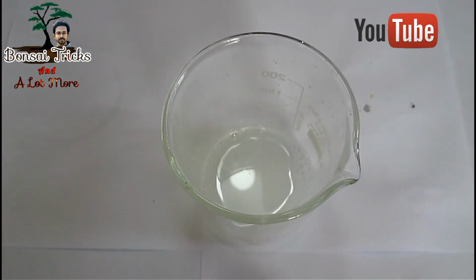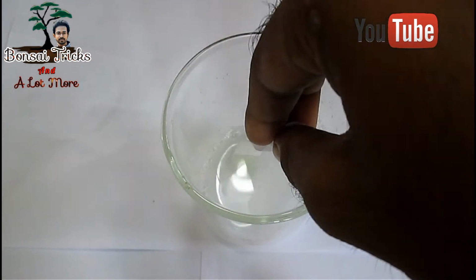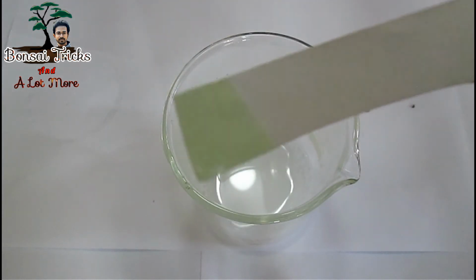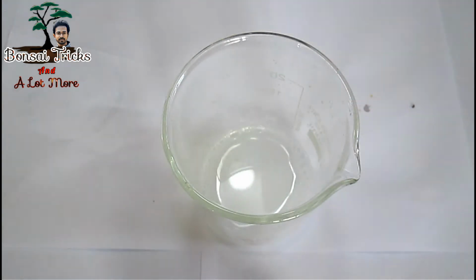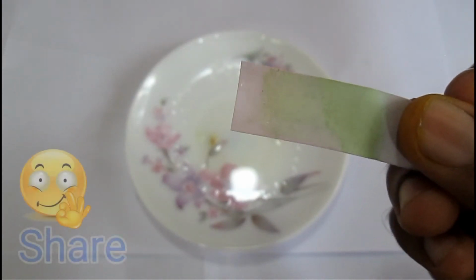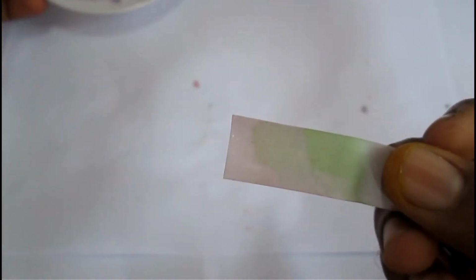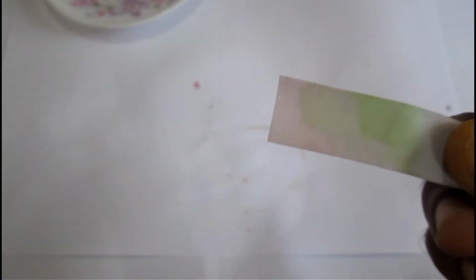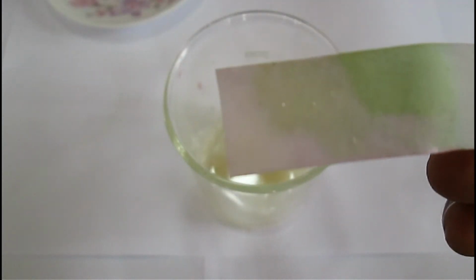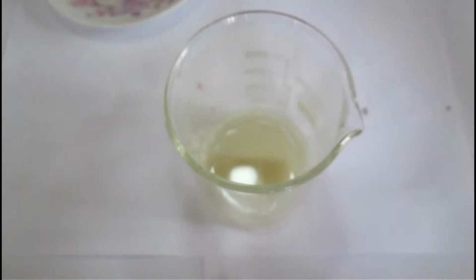Use your finger to coat the entire surface of the paper with your rose juice. And then take out the paper pieces and let them dry overnight. Now let's test whether our pH strip is working or not. I am now dipping our homemade pH strip into basic solution. Friends, can you see that it is turning into green color? Now let's test in acidic solution. You can see that it is turning into red, or the red color comes back in the acidic solution. In that way, we can easily determine the pH level of your soil. I will show you in the video another recipe of pH solution that is more efficient, so please watch the video till end.